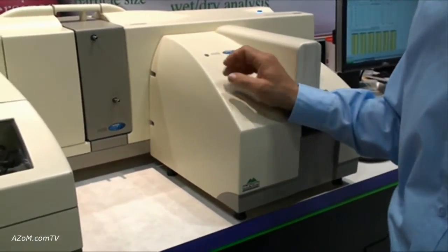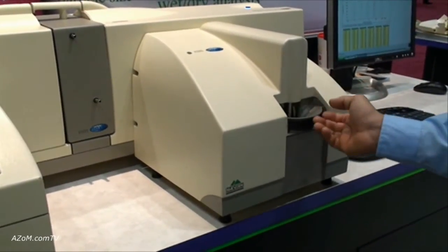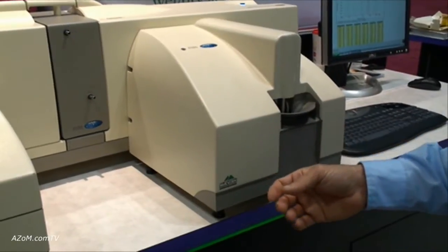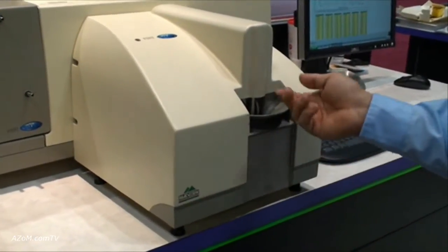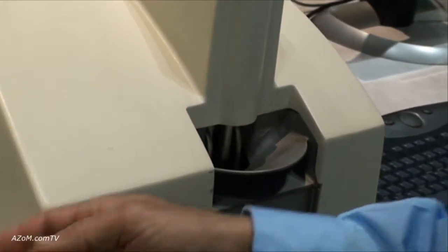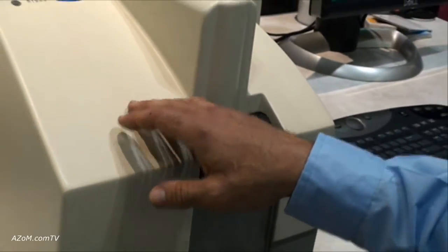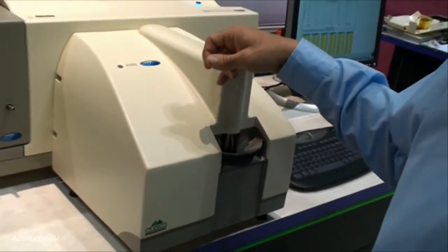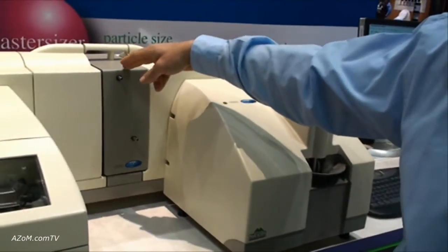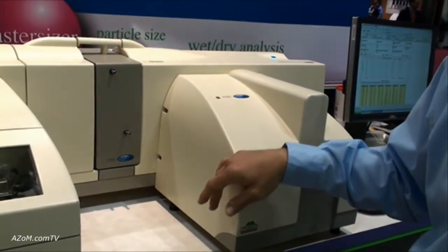This is the Hydro-S, probably our most popular unit. In this case, either the particles are placed in a liquid to create a suspension which is then measured, or if the sample is initially a suspension or slurry, we would add that to a clear base liquid. It could be water, organic solvents, etc. We have a range of solvent-resistant materials that can be added for more aggressive solvents. Once again, a suspension is pumped, stirred, and pumped through a measuring zone here through the instrument and circulated back again for continuous measurement.